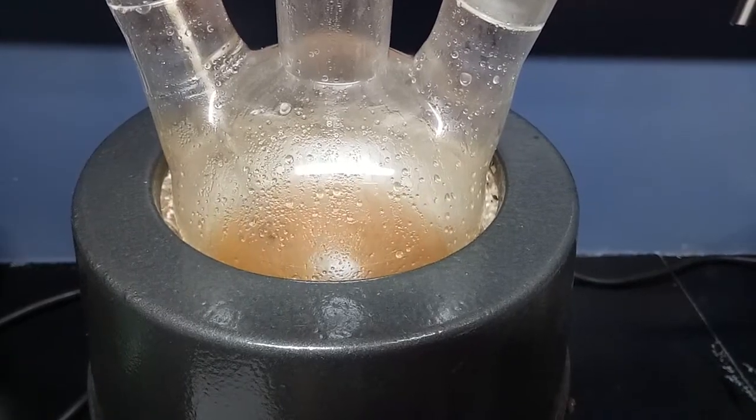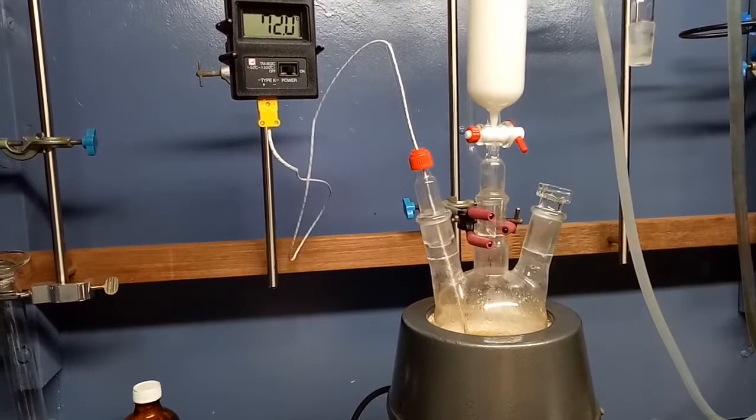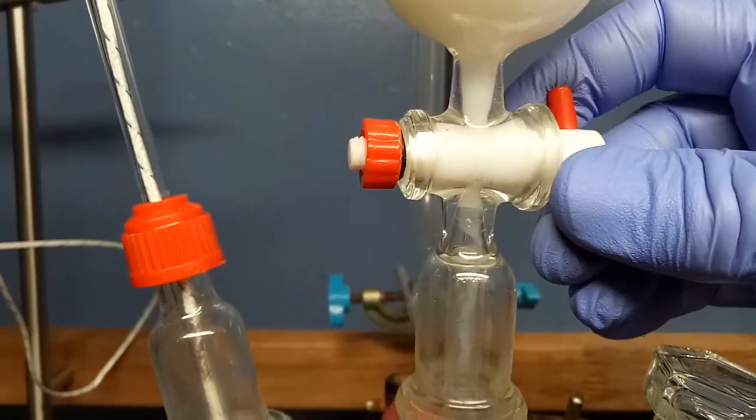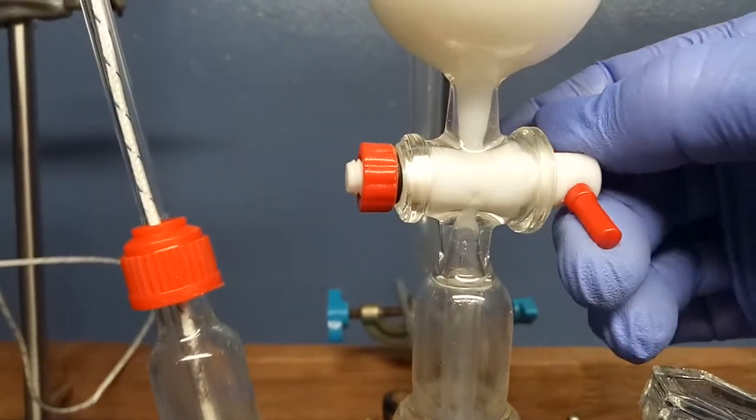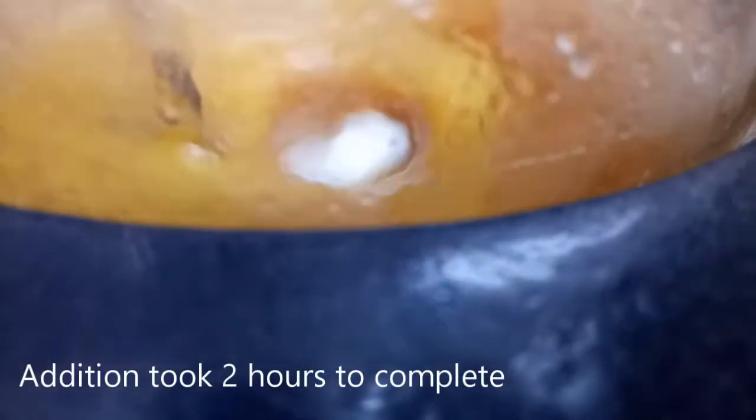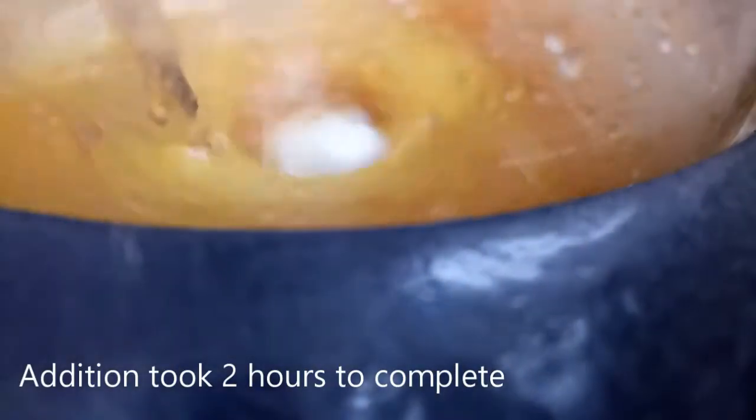A two-phase reaction is never going to be as good as a single-phase reaction. It's just not going to be as efficient. The reaction can only take place at the interface between the particles and the liquid. And no matter how much stirring, and again I have stirring problems, it's just not going to go as well.